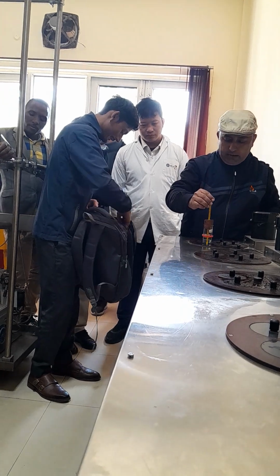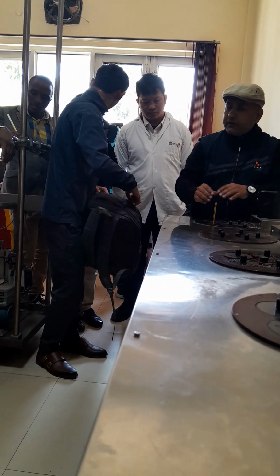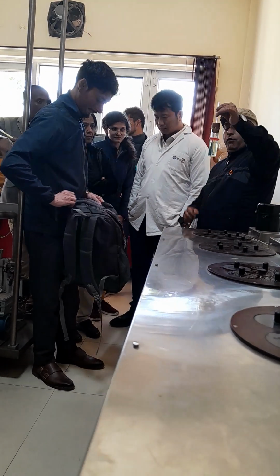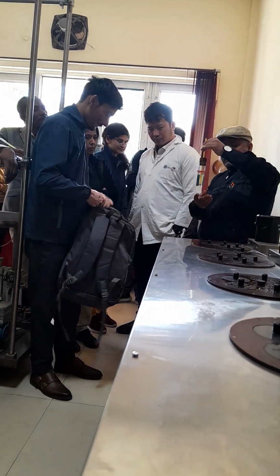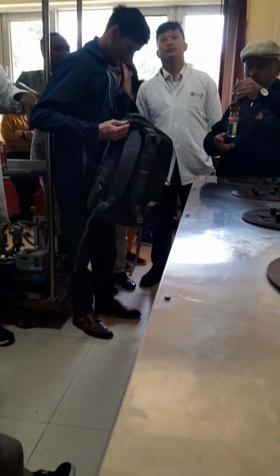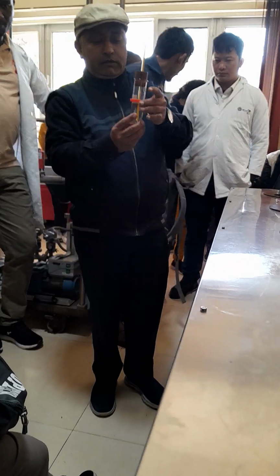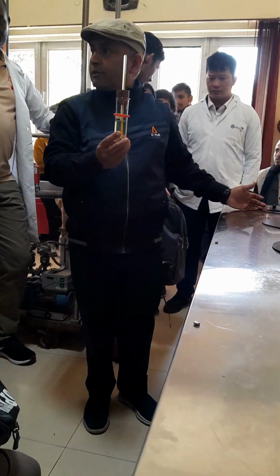So now I am putting it inside. So right now the temperature is being noted. Now it's your duty. Let them see the cloud formation at the bottom of the surface of the tube. You note down the temperature. They will do it themselves. It must be at the level of the liquid. Here, no need of keeping it there. When you keep it here, it will detach from the surface of the cooling.